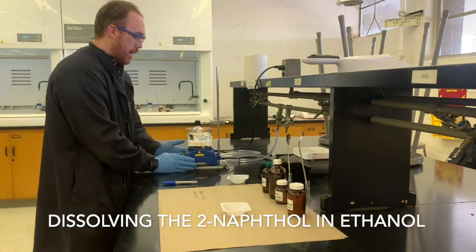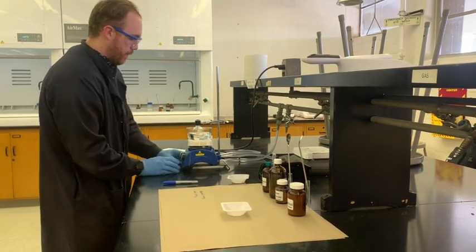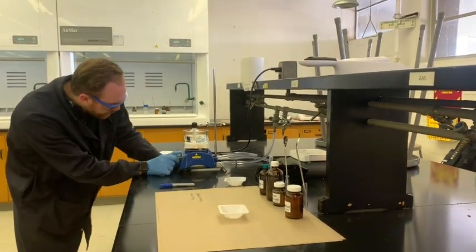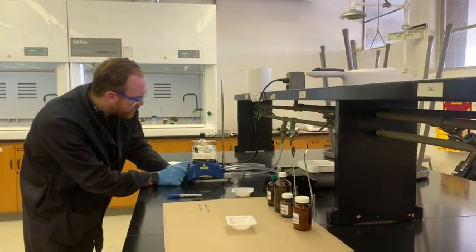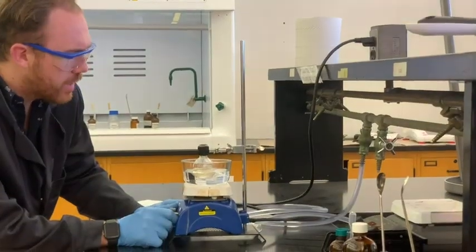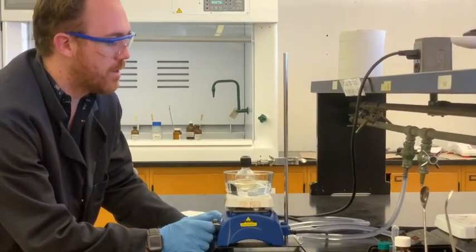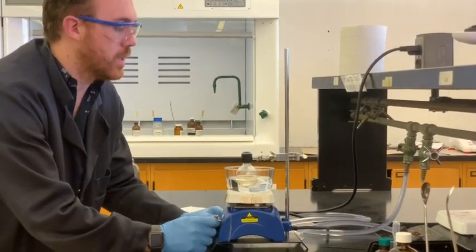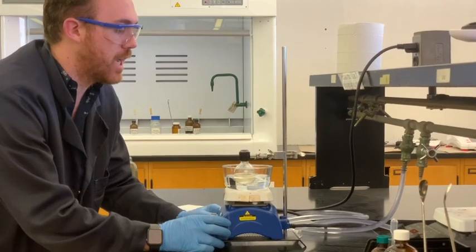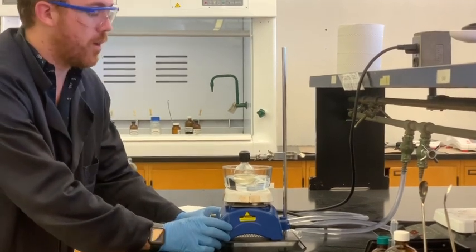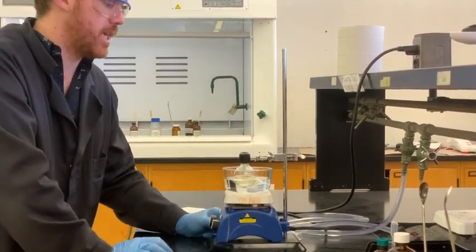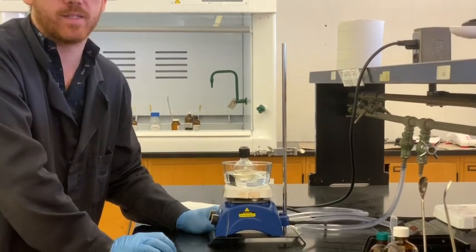So I've got a heat and stir plate right here. I'm going to start stirring this. If you can stir, it really helps the consistency of your reactions all the time. If you're going to be doing some kind of timed or kinetics reactions, try to pick a setting for stir and keep it on that, just to make everything as consistent as possible.